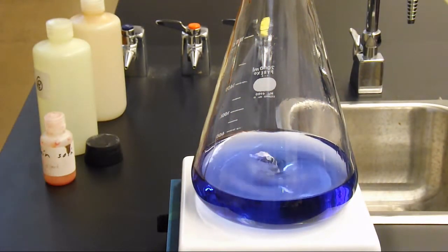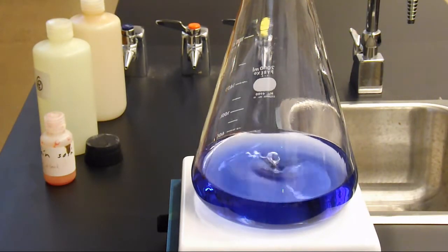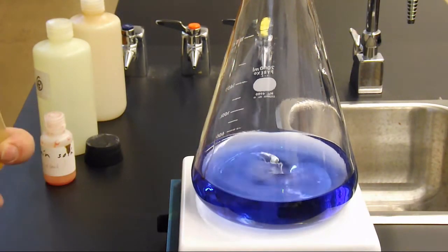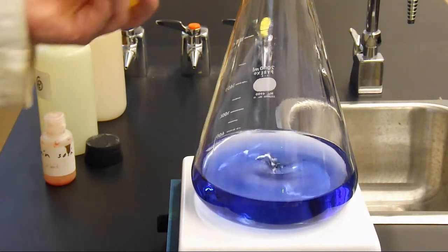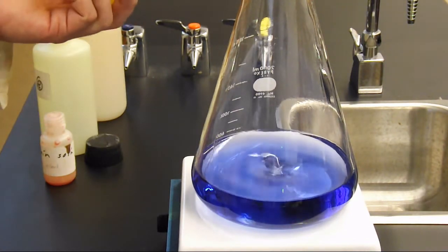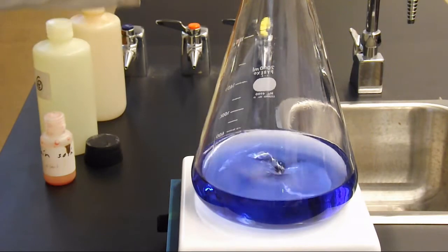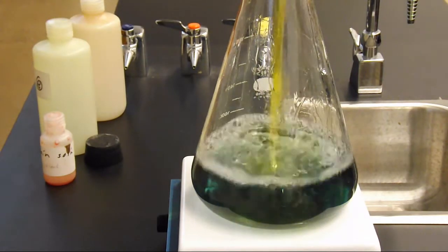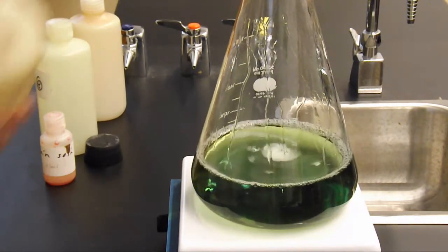Red plus clear apparently gives you blue. And finally we have yellow. Yellow and blue makes? Green. Excellent — you're all budding artists. Yellow and blue makes green, and then we just watch.